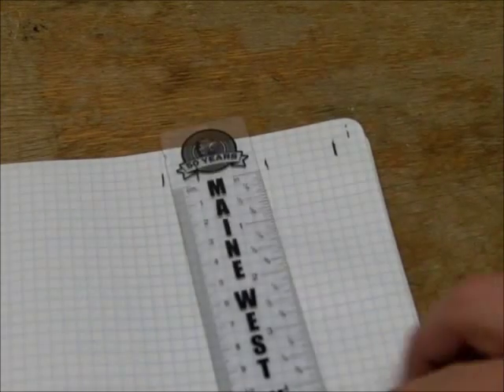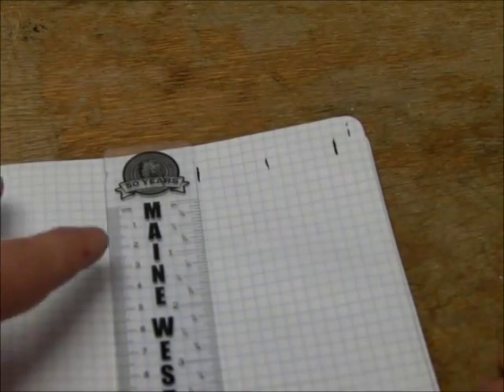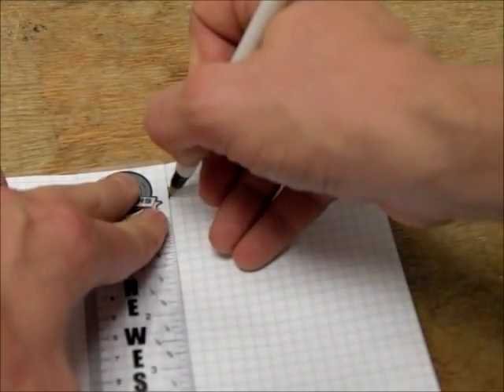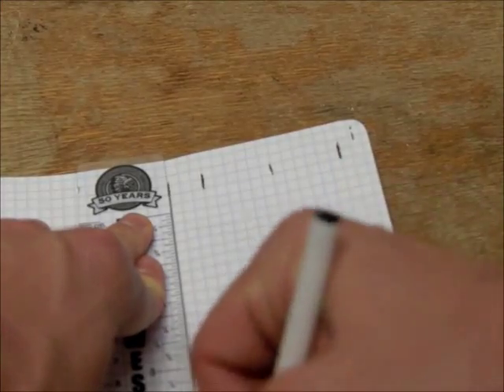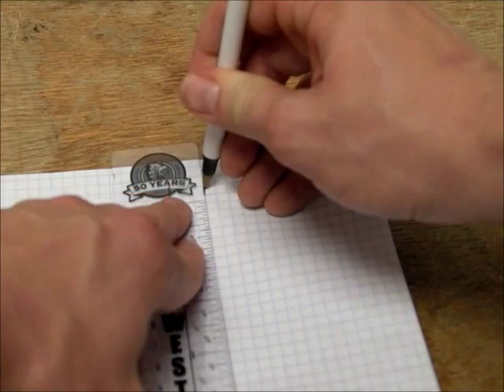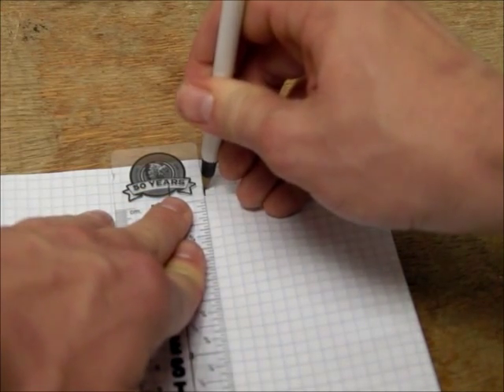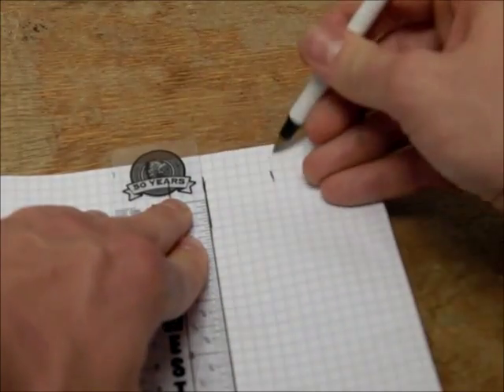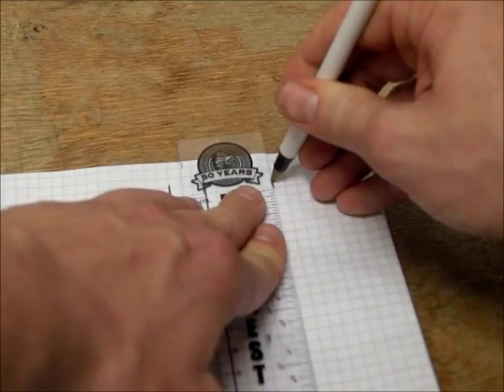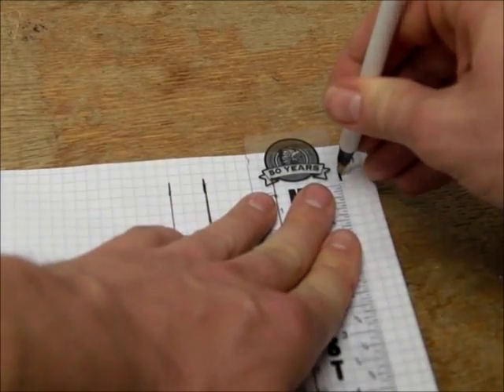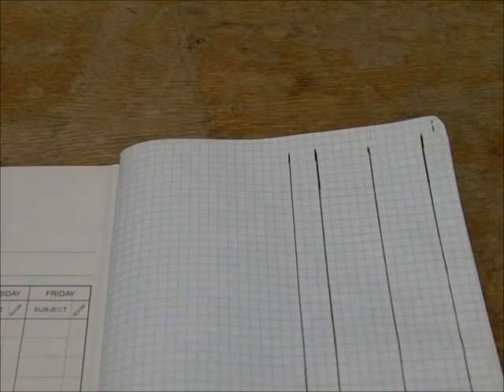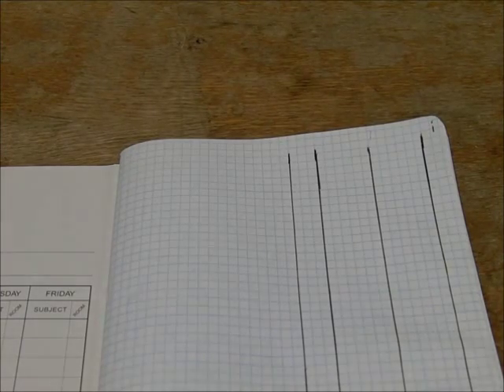With those tick marks, I'm now going to take my ruler and draw a line straight down the page from those tick marks. So now you should have four lines going down the page. We've got the pages numbered, or at least started to be numbered, and we have the beginning lines of our first page set up.